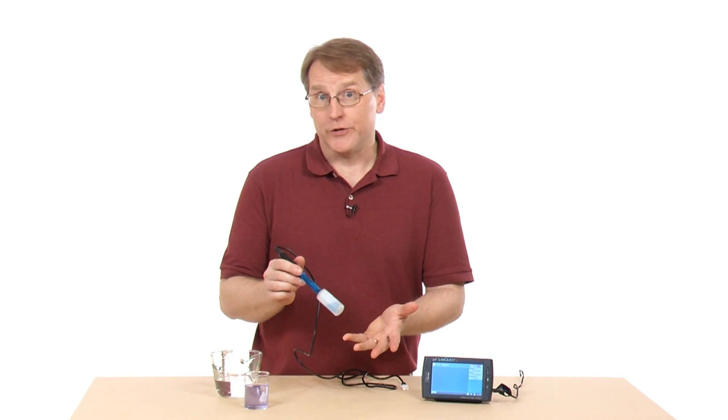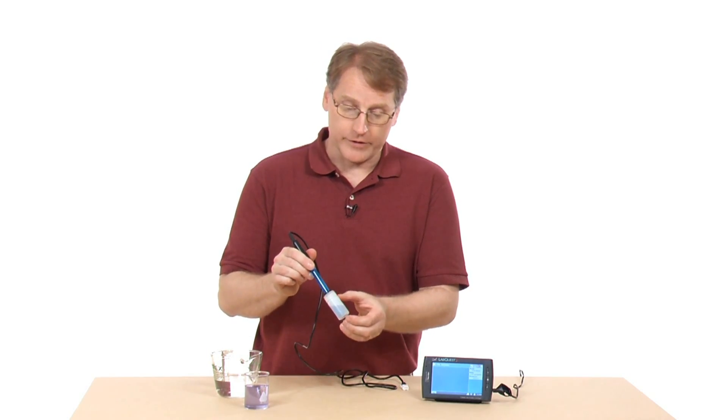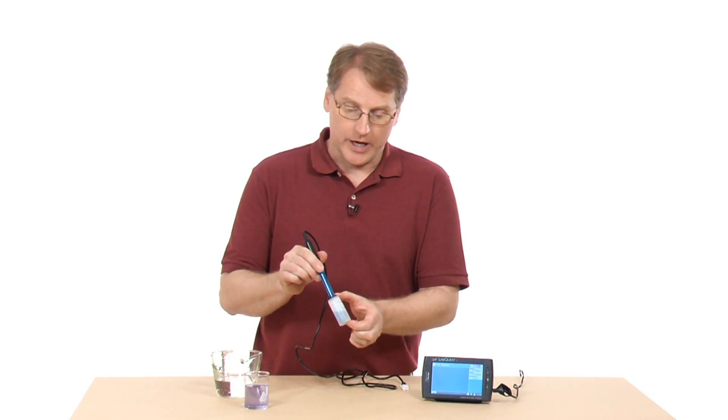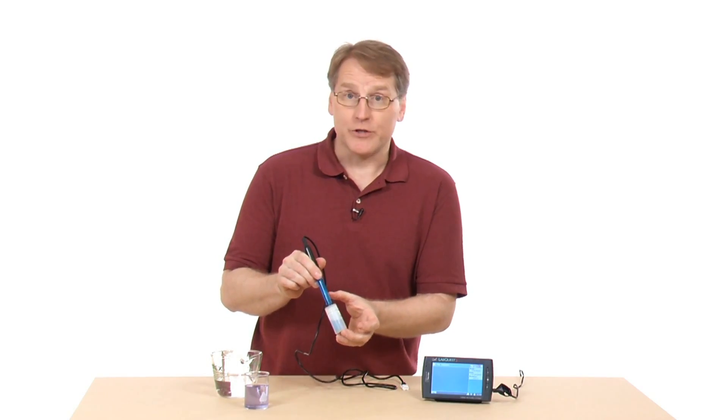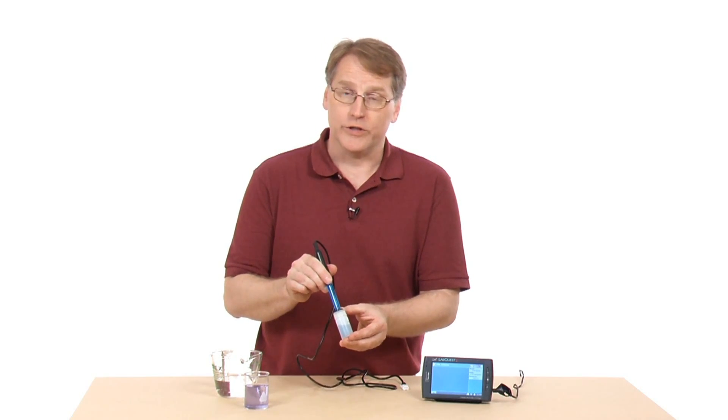It's used to measure the pH of a solution. To use this, you need to take it out of this storage solution. This is a pH 4 buffer solution that keeps from damaging the sensor, so you want to make sure you always store it in the solution.